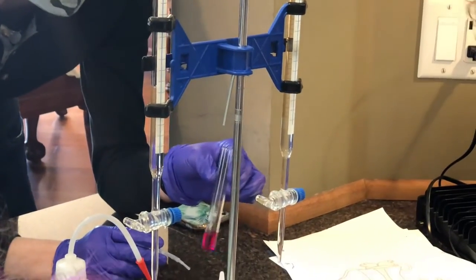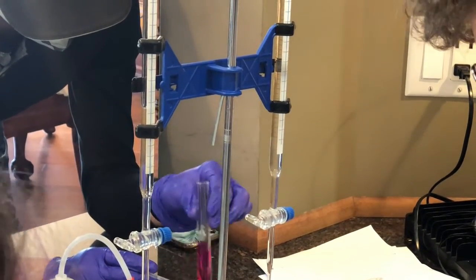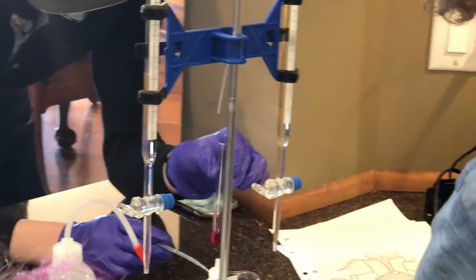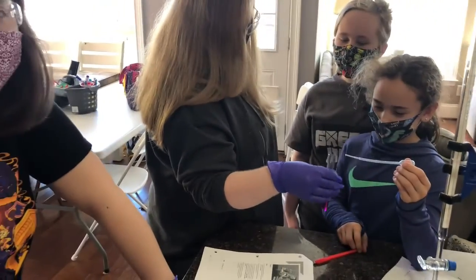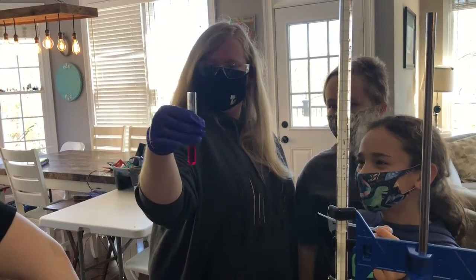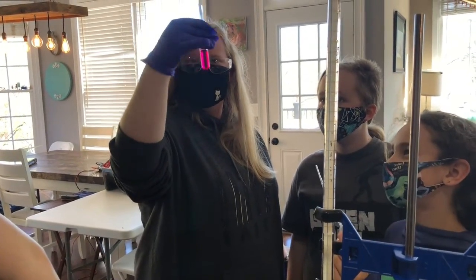19. There we go. Yeah, that's true. I saw it. One more. Oh, I've lost count. Let's go. We lost count. I didn't understand it. Solve! Okay, I think you got it.